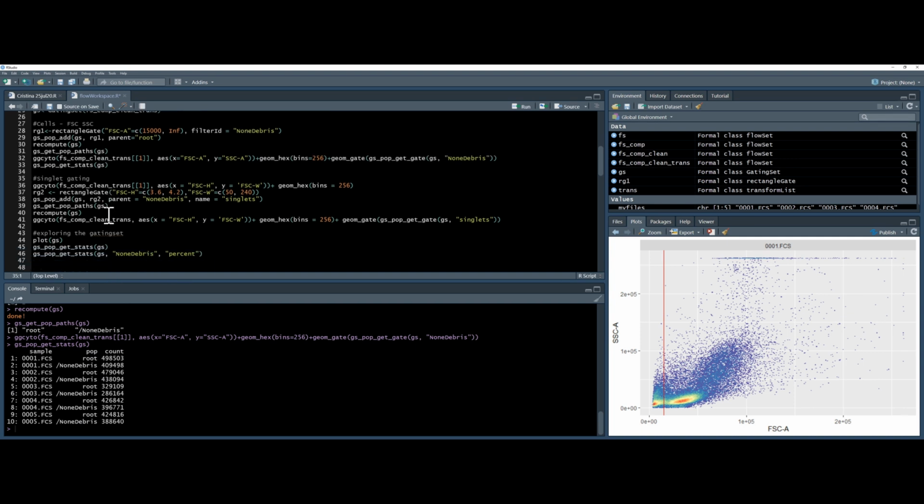So next, I want to do some singlet gating. So I want to do my forward scatter height versus forward scatter width. The first thing again I want to do is just look at the data to judge where I want to put the gate.